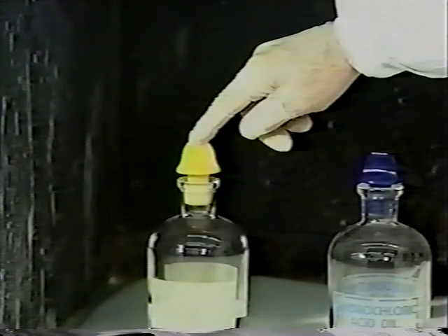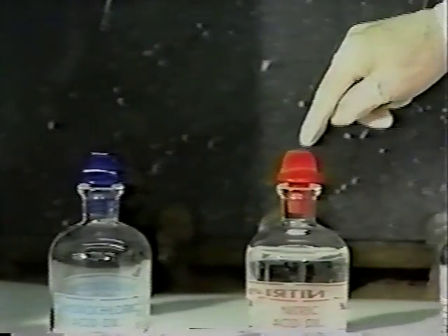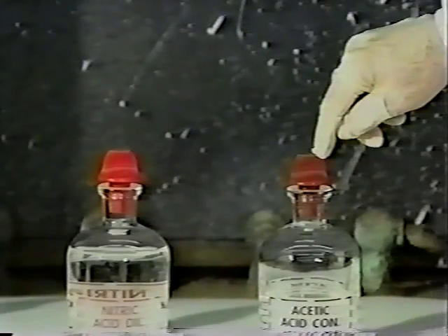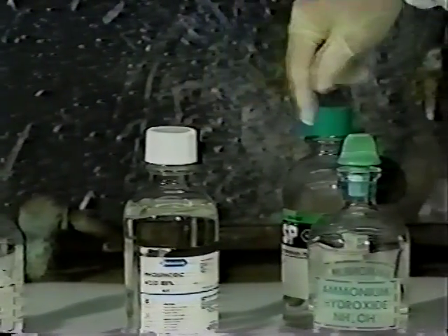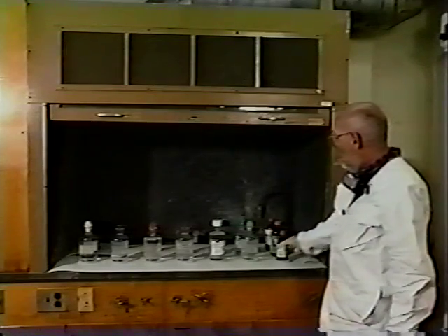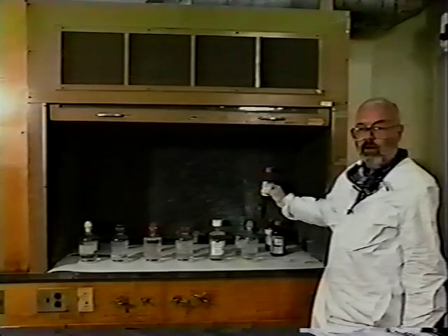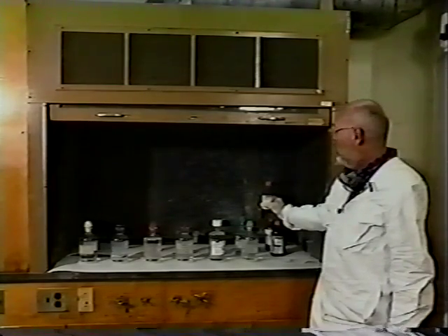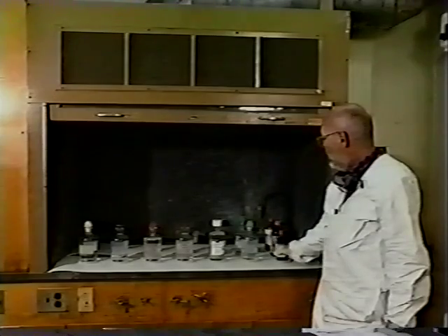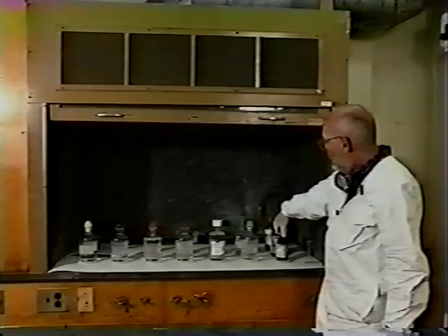Sulfuric acid is identified by yellow, hydrochloric acid by blue, nitric by red, acetic acid by brown, phosphoric acid by white, ammonium hydroxide by green, and a variety of reagents otherwise unrelated in structure or chemistry, but which have a high vapor pressure — that is, they're quite volatile — and the vapors of which are quite toxic, are identified by orange caps.